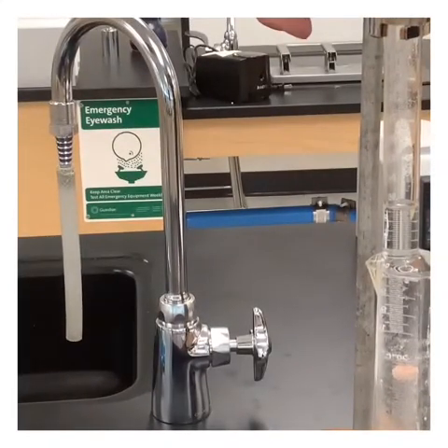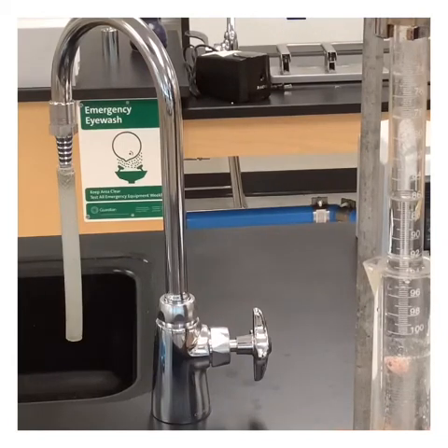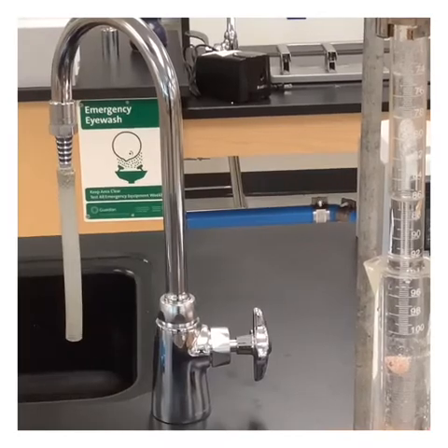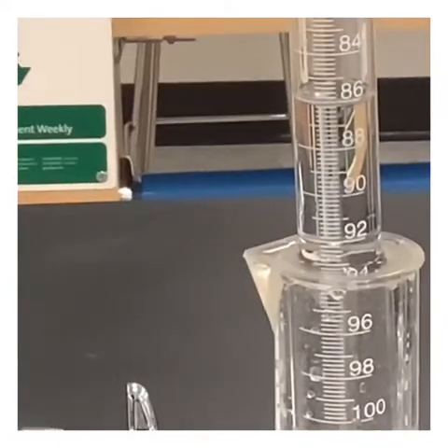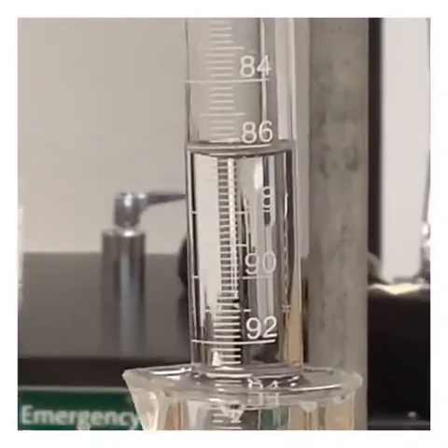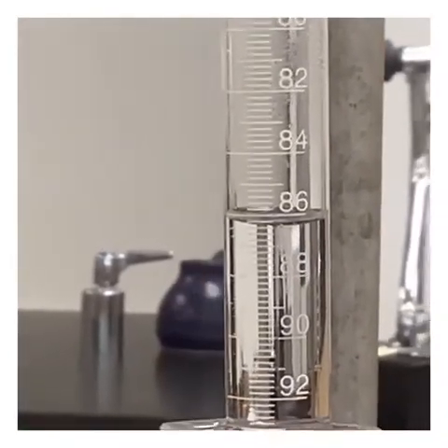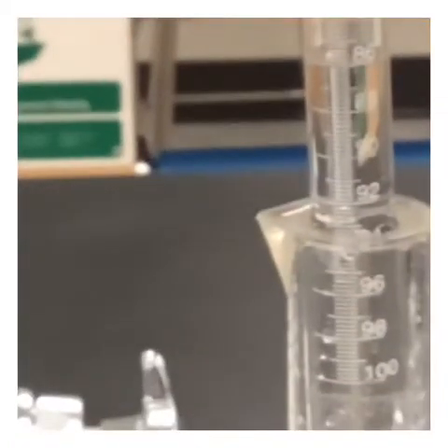Let's loosen this. Okay, so we're getting that turned. So let's take a look at the volume. Let's zoom in on this. What do you guys have that as? Or I should probably get down to eye level. That would be better. Eye level it is. Sorry if I'm making you sick here. Okay. So let's go ahead and record that.